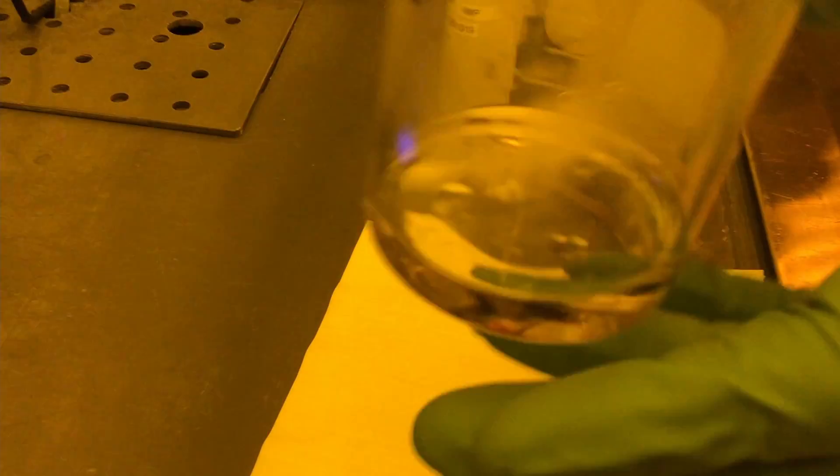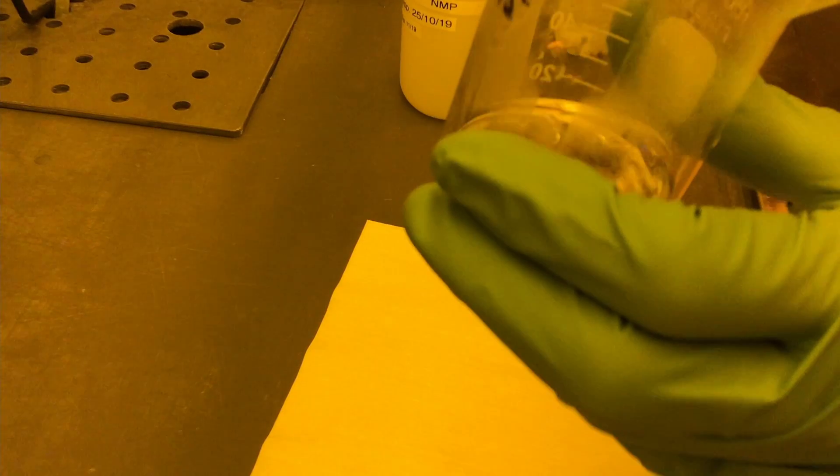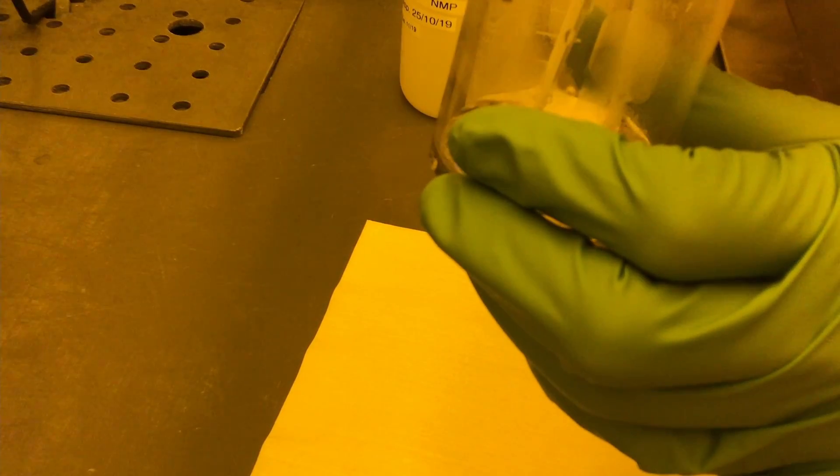Do not vibrate since the thin film of gold may fully peel off from the sample surface.